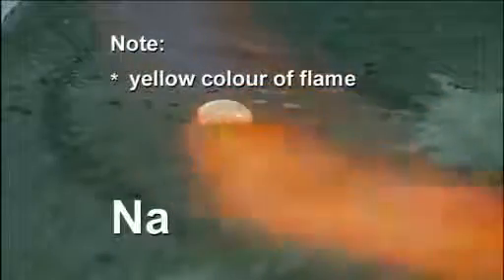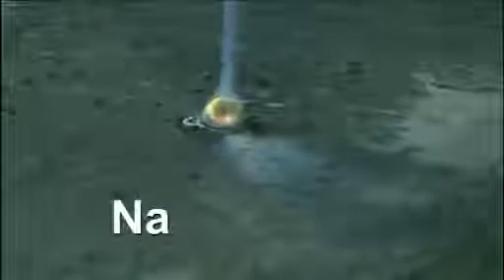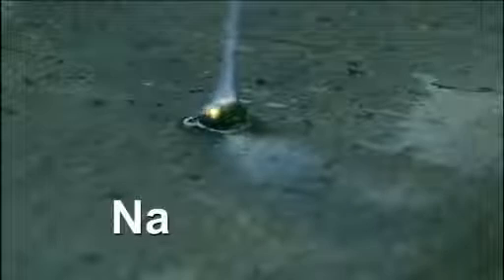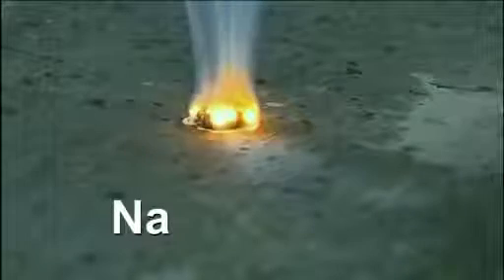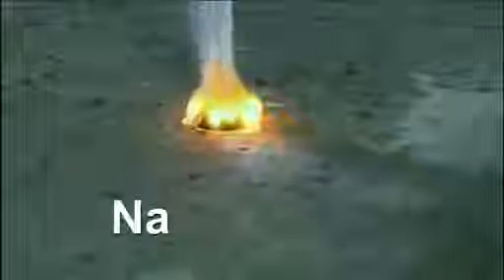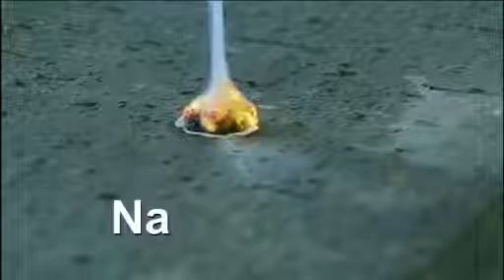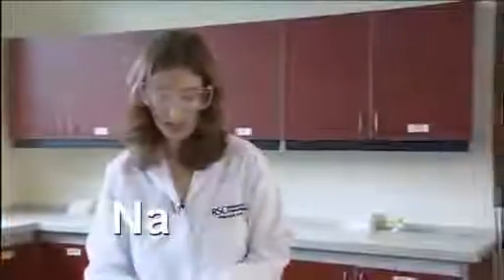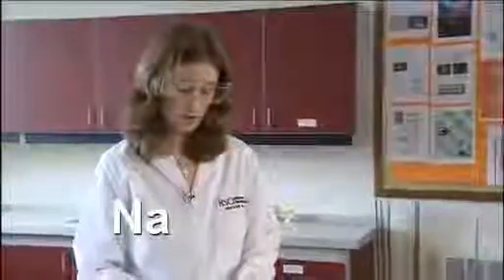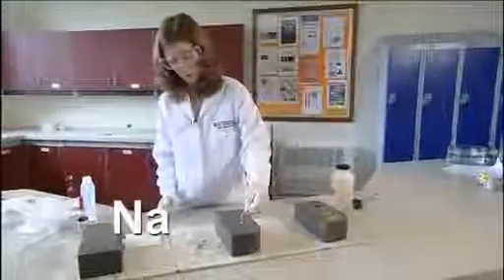Again with a roaring Bunsen flame. You see it melting, and reacting with the air. You can again test the residue of sodium oxide with some moist indicator paper.